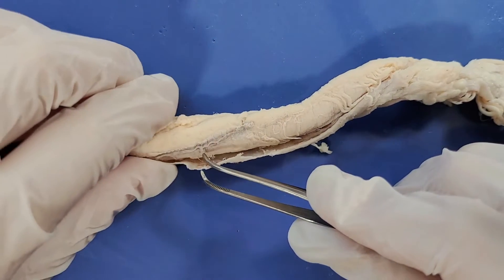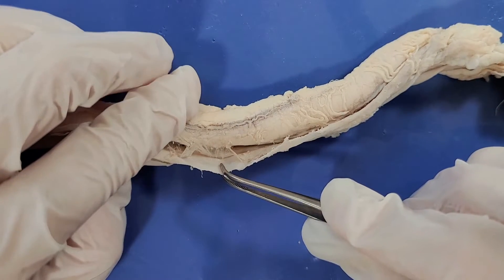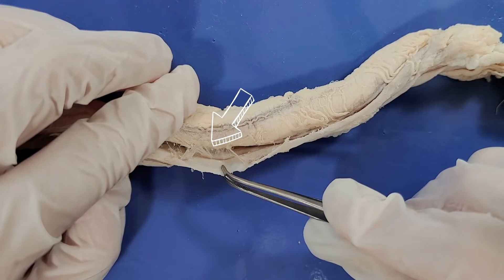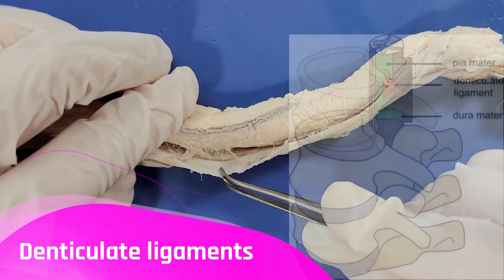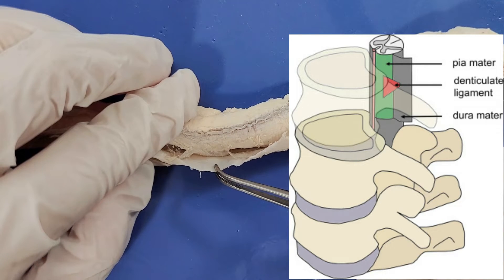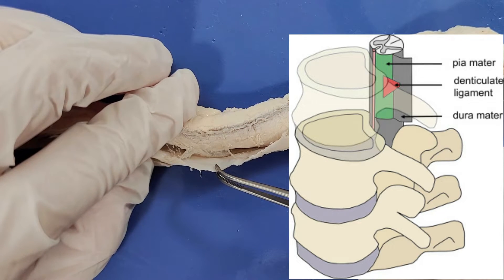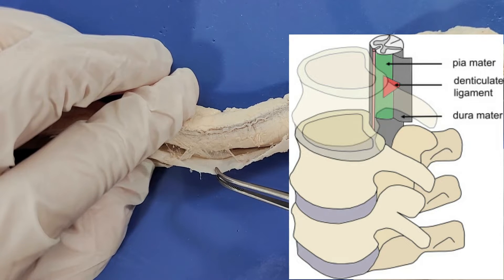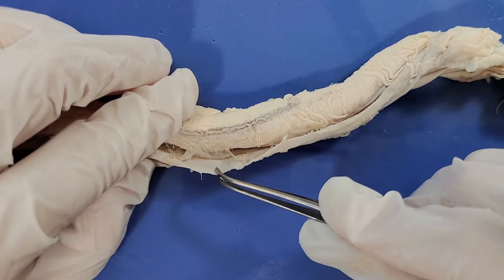Along the sides you can see these triangular ligaments — you can see one right here — and these are called the denticulate ligaments. They attach the pia mater to the dura mater. These denticulate ligaments help to anchor the spinal cord and prevent side-to-side movement, providing stability.